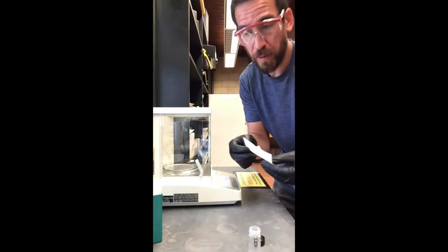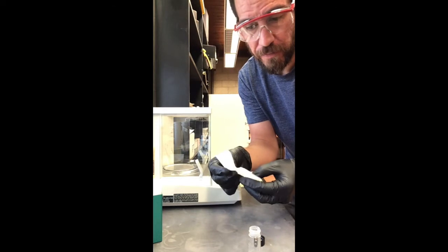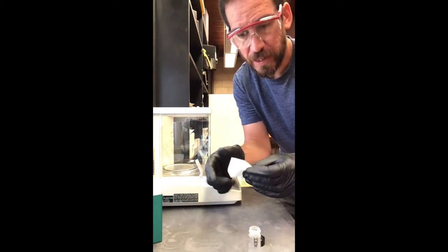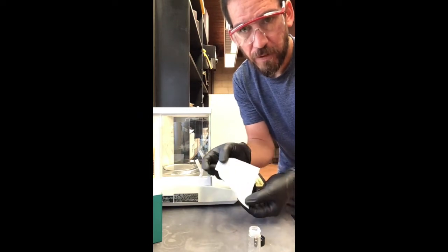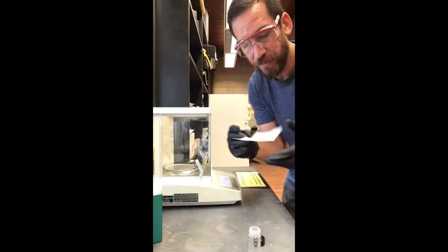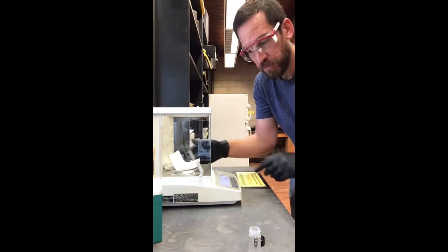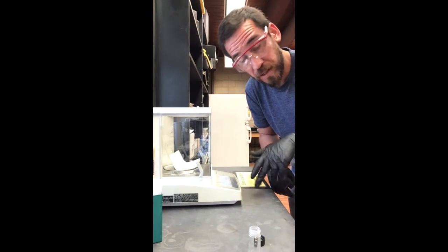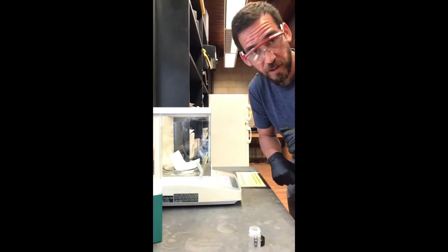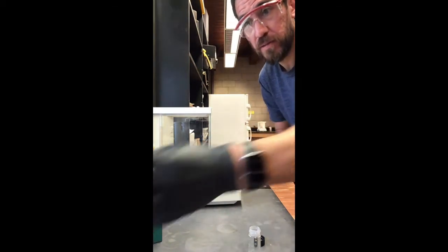Grab some white paper, fold it in half, seal it up, fold it in half again so you've got four squares. Place that on the scale and press the zero or tare button so that you get only the mass of the solid you're adding to the weigh paper.